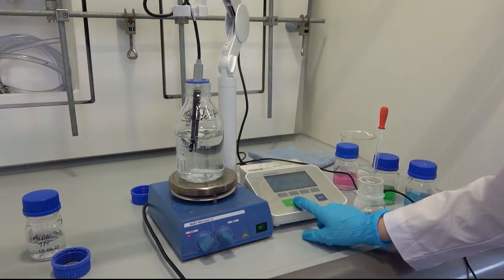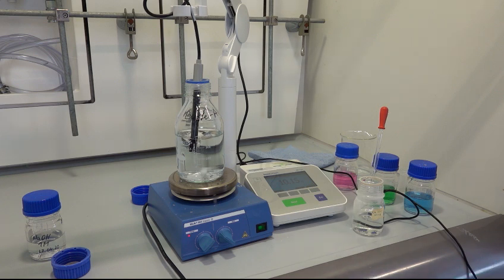The sensor of the pH meter is placed into buffer A and the pH level is measured. Hydrochloric acid or sodium hydroxide are used to adjust the pH level to 10.